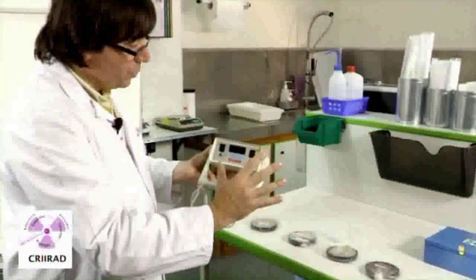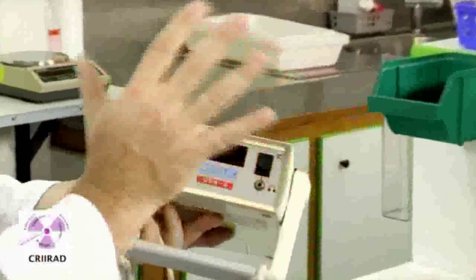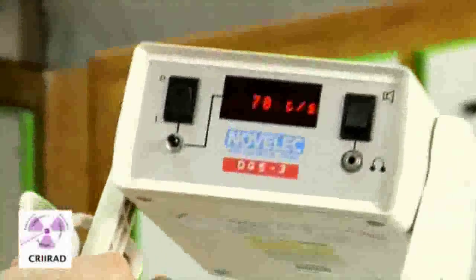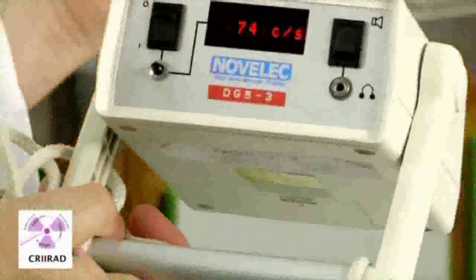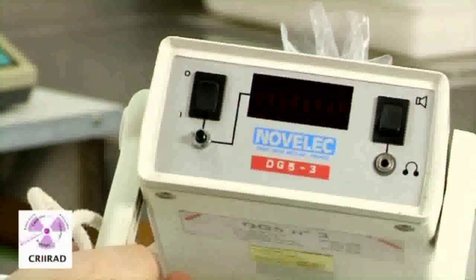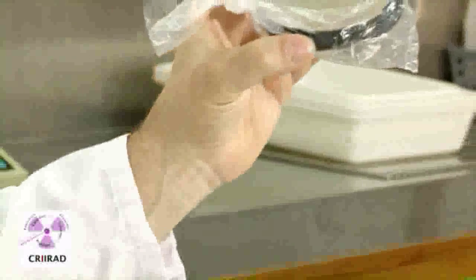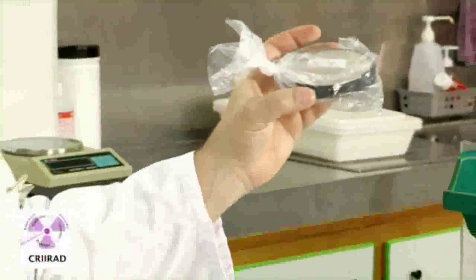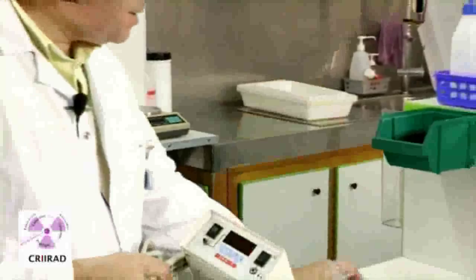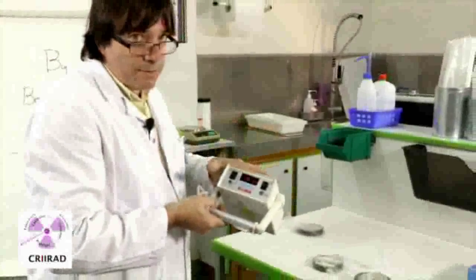There is a statistical fluctuation. We have between about 50 and 80 counts per second. If we check this first sample of mushrooms, we detect no increase of radiation. Because in this sample, you have between 100 and 200 Becquerels of cesium-137.